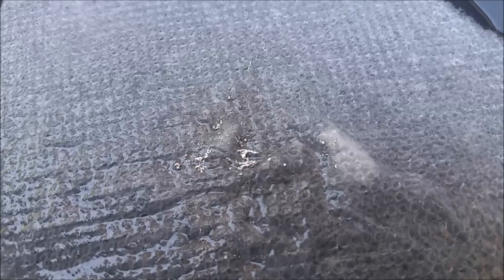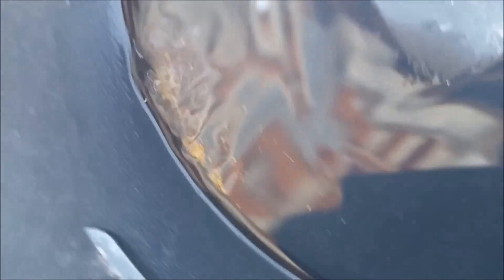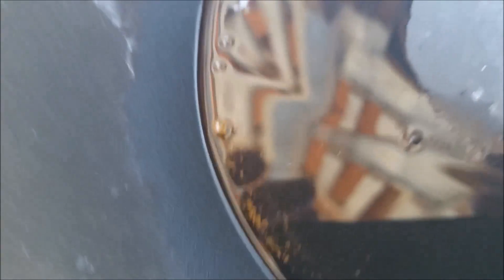All right, there's the gold — washed off the rag and then dissolved the mercury with some nitric acid. A few minutes in the acid and there's all the gold. Look at that. It's still in a little ball there, but it'll break up.